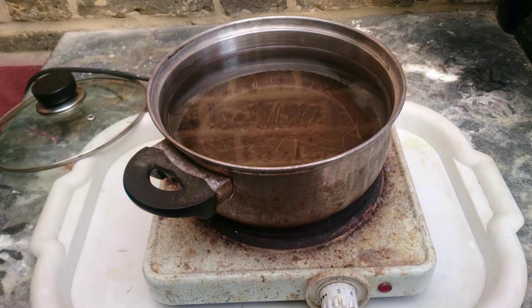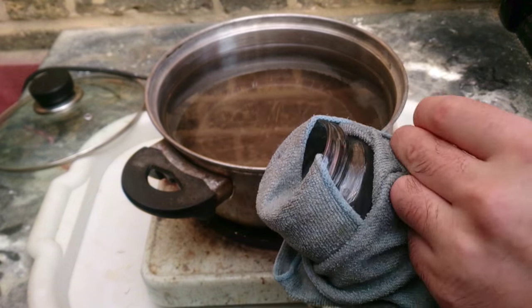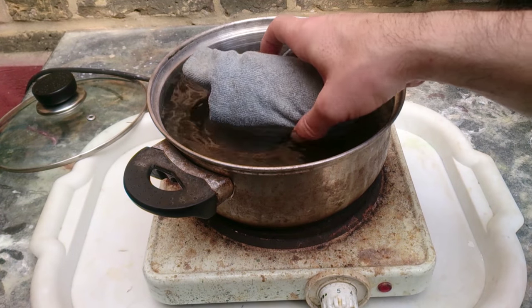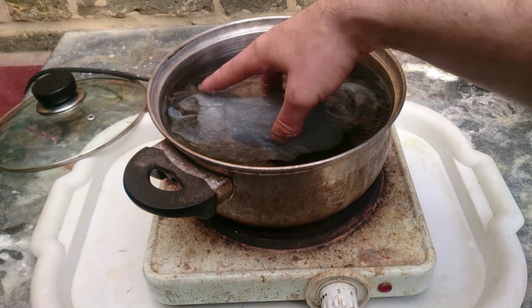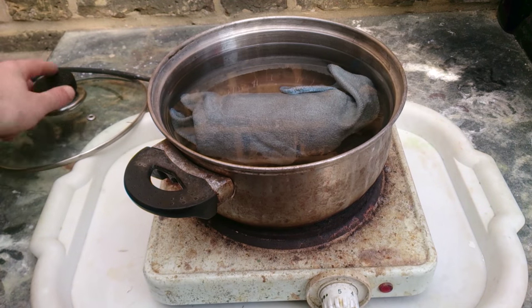For now we do some voodoo magic. Take any vessel — in my case it's the same rusty kitchen pot I used in my other videos — and fill it with cold water. Wrap a glass jar into any fabric or even a kitchen rag, and boil the jar on slow heat for about two hours or so. I will skip it in the video because there's nothing special. The rag is needed only to dispense the heat evenly.